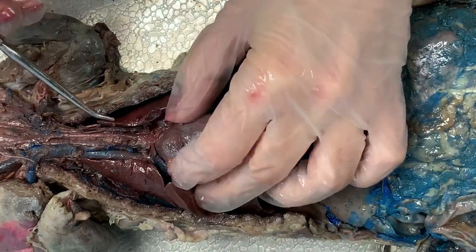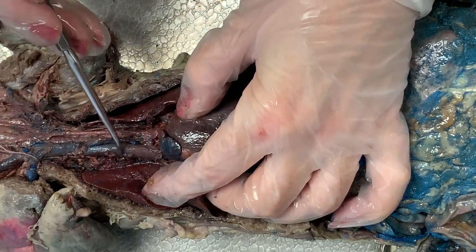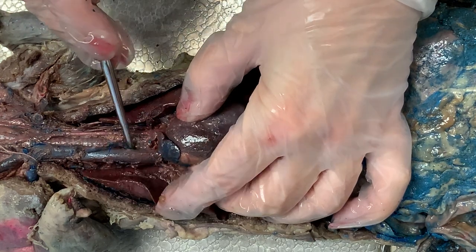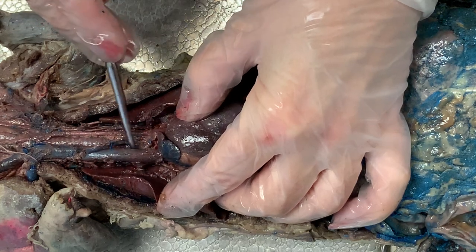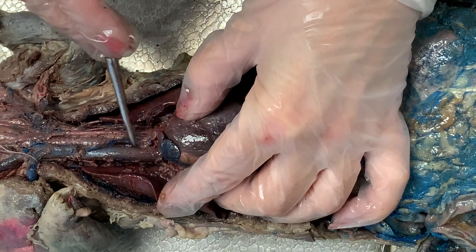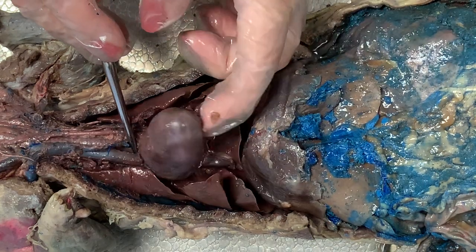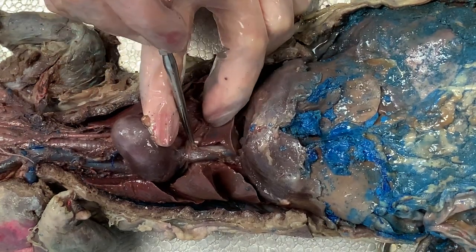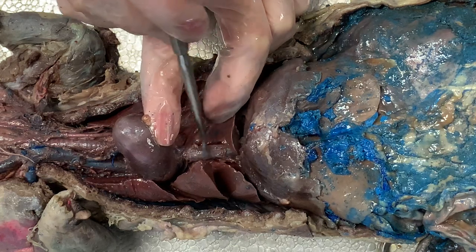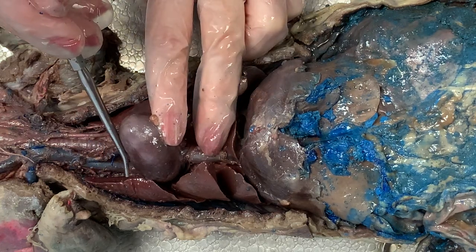A couple of vessels coming off the top of the heart: draining blood into the right atria where the right auricle is, is the superior vena cava. That's pretty easy to pick out — a lot of times it will be a nice blue color, or a dark brown if your mink did not stain. Underneath the heart, we have the inferior vena cava — I'm running the probe right across the top of it. Both of these are veins carrying blood into the right side of the heart.